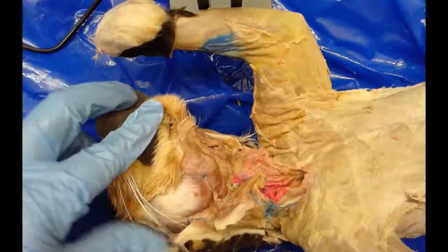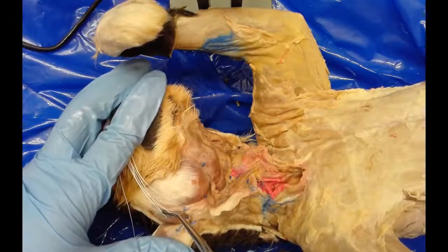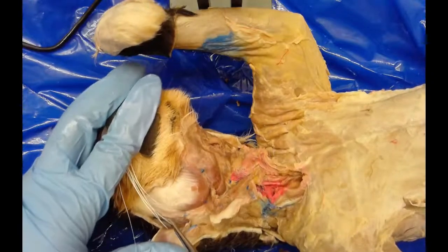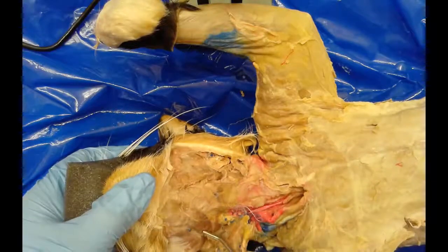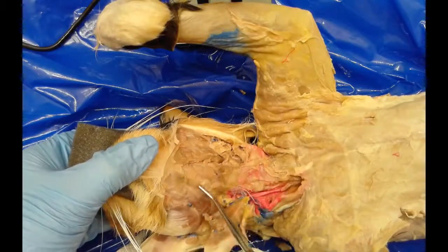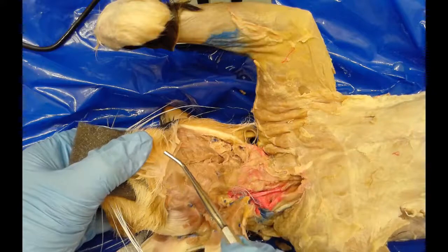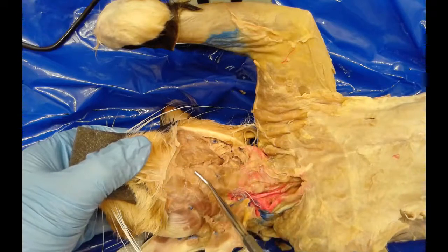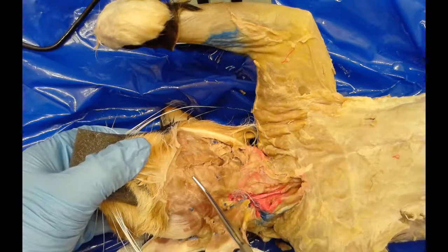Going more anterior, if I move this little flap of skin out of the way, I can see another muscle just anterior to the masseter — that's the temporalis muscle, covered by a really tough layer of shiny fascia. Looking more medially, I can see two muscles doing an upside-down V shape — these are called the digastric muscles, forming an upside-down V that points to the tip of the lower jaw. In the middle of that is a thin sheet of muscle called the mylohyoid, important in allowing the cat to swallow and produce sound.